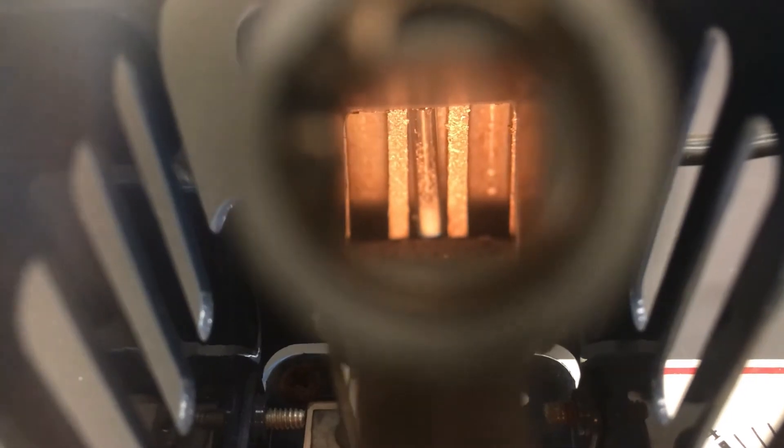You want to increase the temperature at a somewhat slow rate, but bring it up to roughly 20 degrees or so below the expected melting point. Then turn it down and go at a much more slow rate, because we want to catch the temperature where this substance melts. We're going to be recording two numbers, so our melting point is going to be more like a melting range.